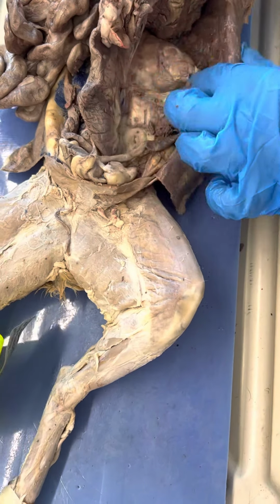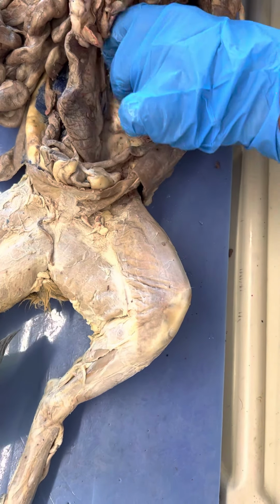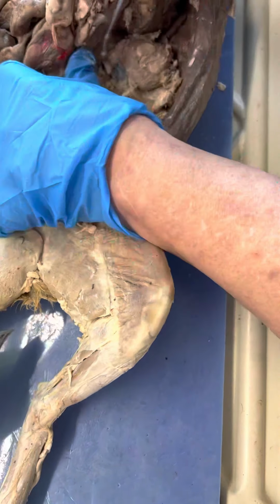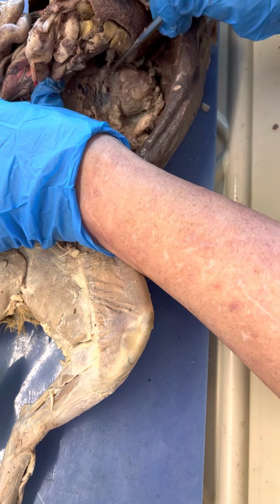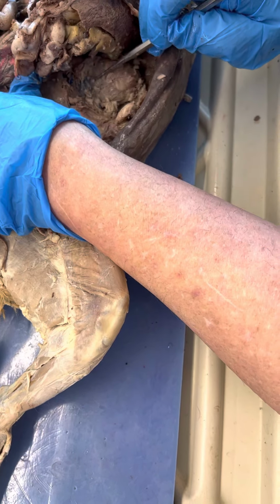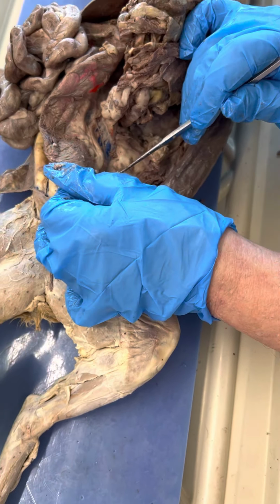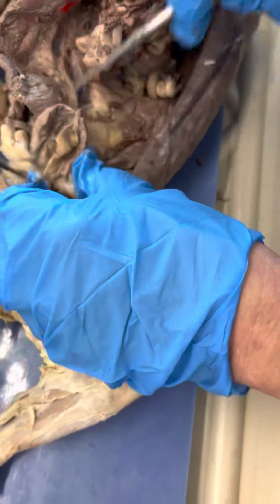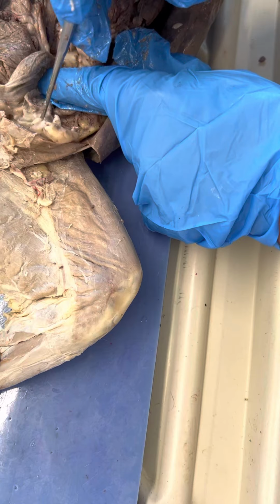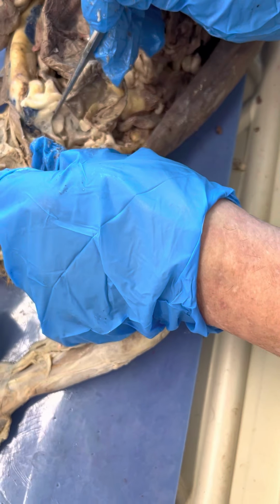It would come off the kidney. God, I've never seen so much fat on any of these in my life. But coming off the kidney, you should see it. You can see blood vessels, it would be white, it would come down, and it would go down to the bladder, and that's your bladder. I'm not sure how far they'd go with that. This would be the bladder. I could get the urethra on the bladder. I'd have to get the fat off of it, and I should be able to see the urethra going out. Yeah, because they changed it like 3 days. This is where if you didn't finish your dissection, it could hurt you.